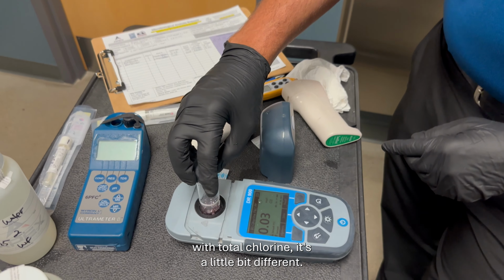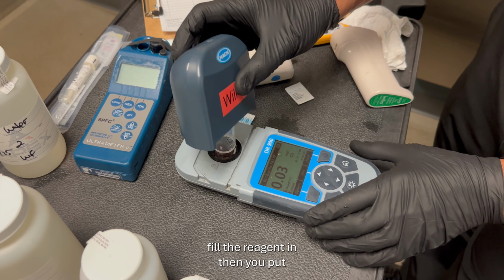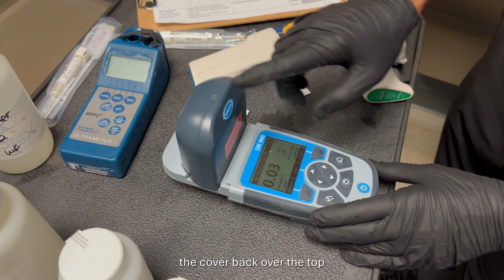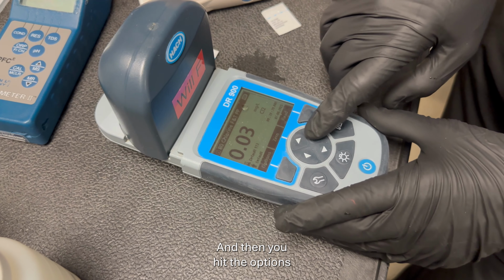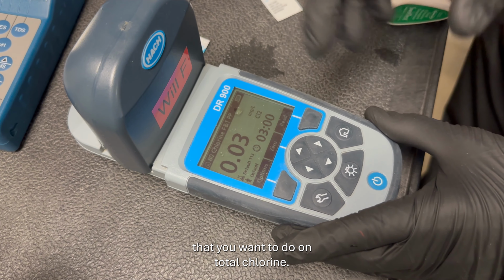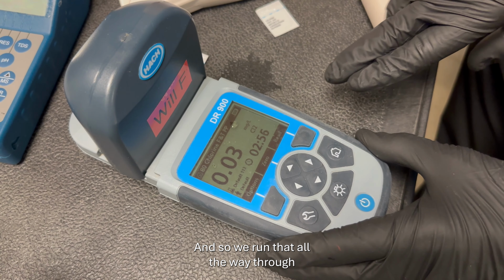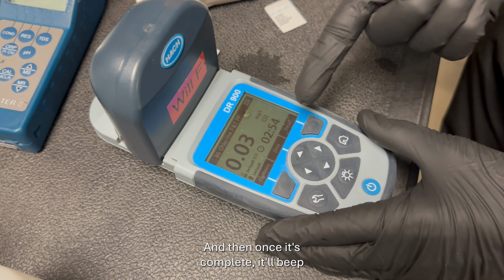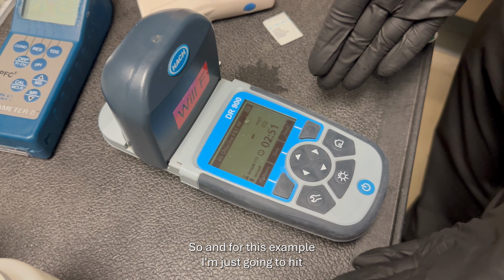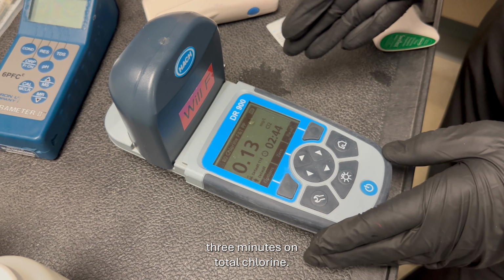With total chlorine, it's a little bit different. You fill the reagent in, put the cover back over the top, and then you hit the options, and then start timer, and there's a 3-minute timer that you want to do on total chlorine. So we run that all the way through until it's complete, and then it'll beep, and you would hit read. For this example, I'm just going to hit read right now, but usually we wait for that 3 minutes on total chlorine.